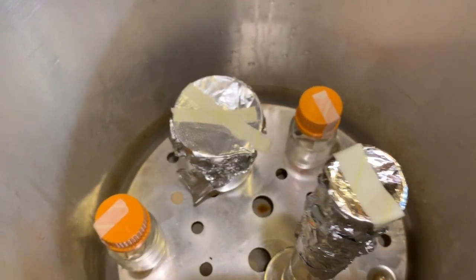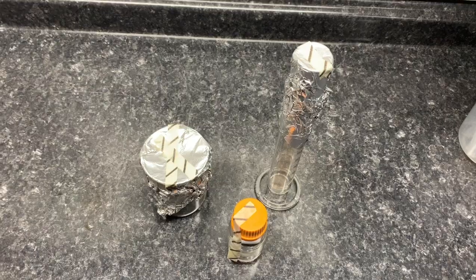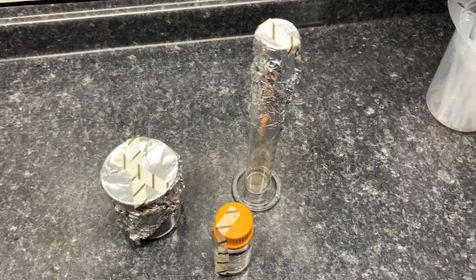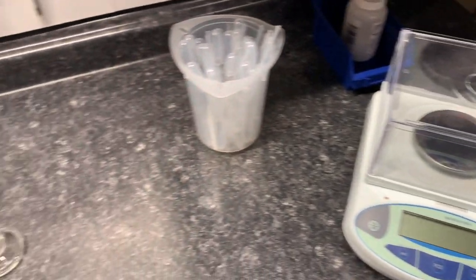First, you must sterilize all necessary items. After the necessary items are sterilized you must prepare the rest of the instrumentation.